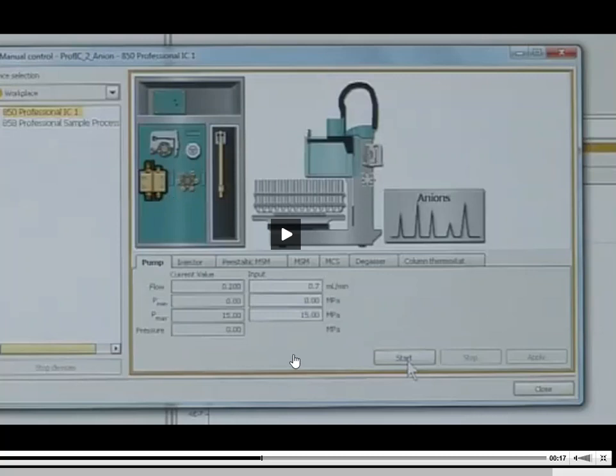Here is the screen that you're going to see for the purging. This is typically found in the manual button over on the bottom left-hand side of the screen of the software. When you click manual, this screen will pop up. You can see up here it says manual control. What you can do is click on the pump icon right here up front and center. When I click on the pump icon, all of these options down here are going to activate, and it shows me the flow, which is right now set at 0.7 mL a minute.